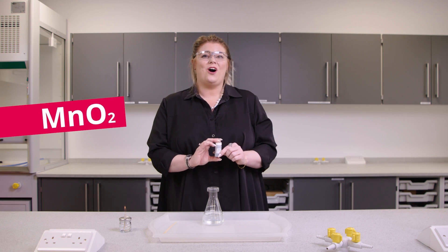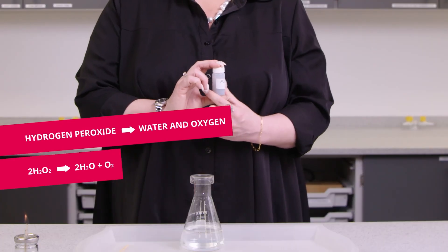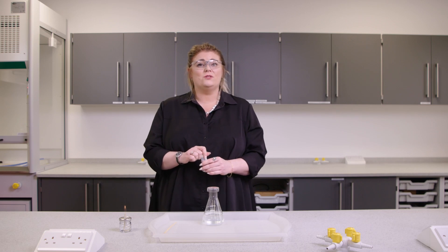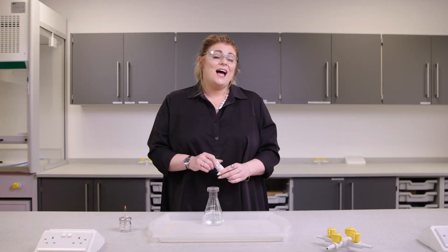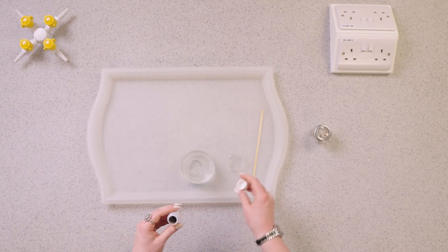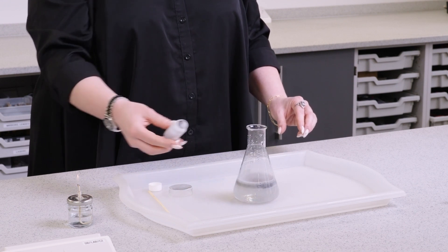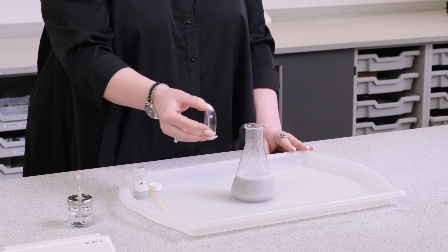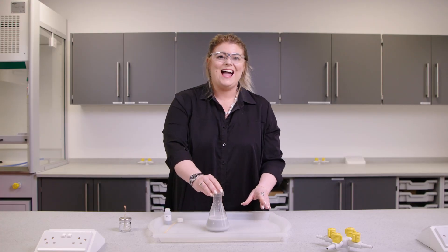This chemical is manganese 4 oxide — it is a chemical catalyst. The reason the catalyst isn't shown in the equation is because it isn't used up in the reaction; it is regenerated at the end. I'm now going to add some of the manganese 4 oxide to the hydrogen peroxide. As you can see it's much quicker and there are fumes of gas being released. The reaction feels warm because heat has been produced — this is what we call an exothermic reaction.